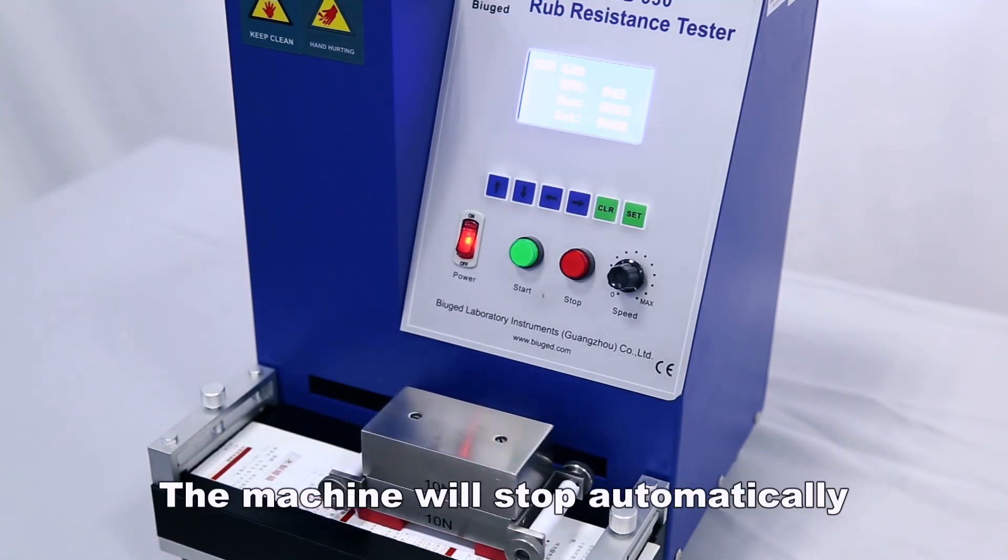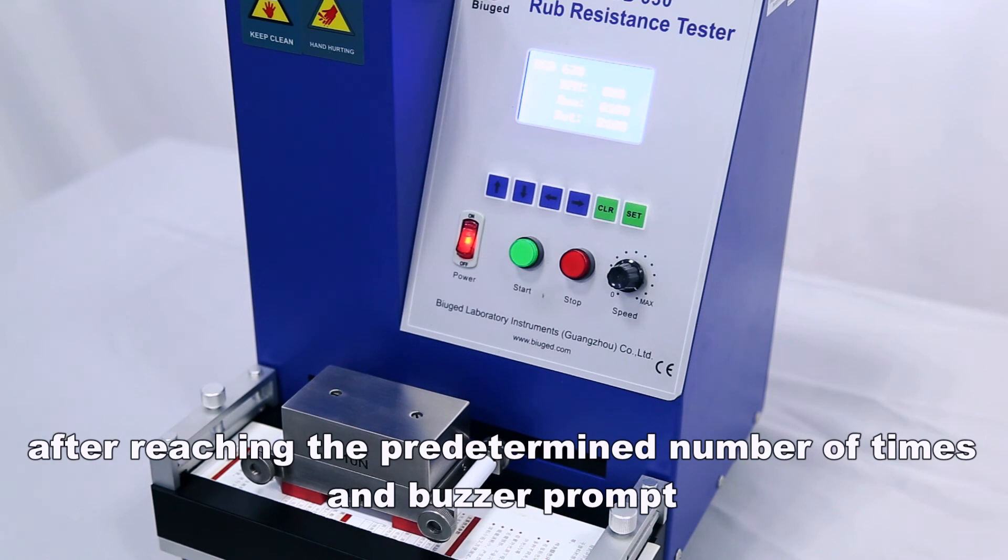The machine will stop automatically after reaching the predetermined number of times and buzzer prompt.